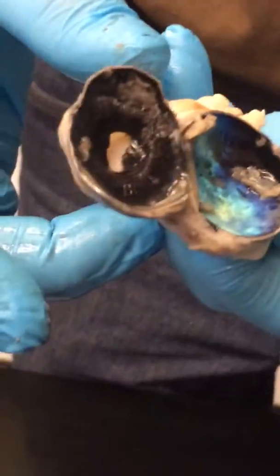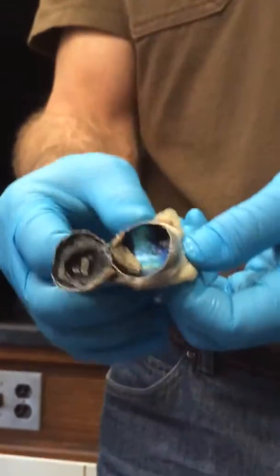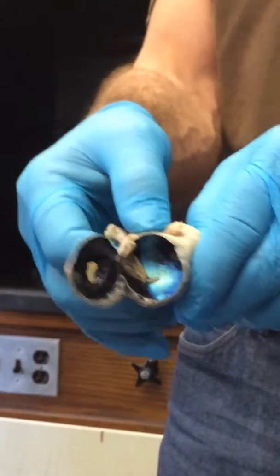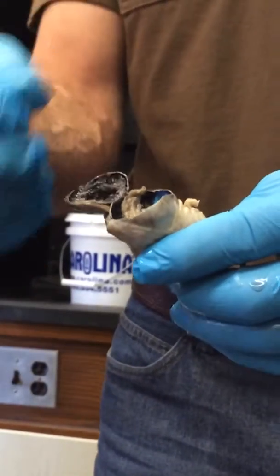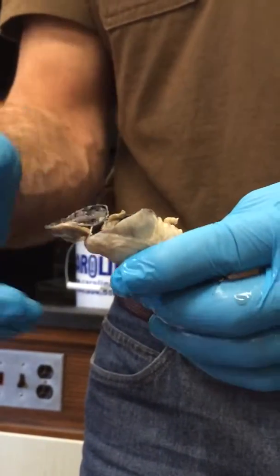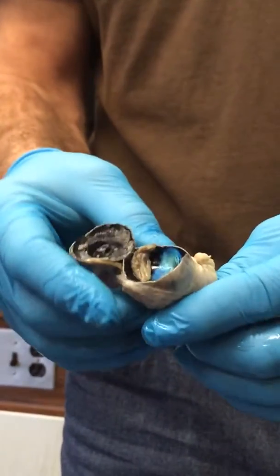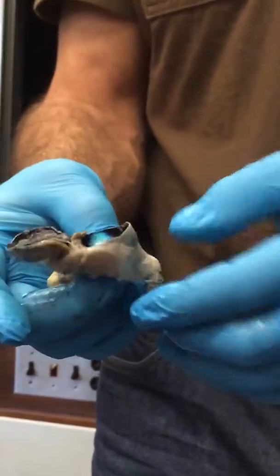And this is one of those things that if you shine a light into the eyes of a dog or a cat or a deer or a fox, and you see the green or the blue, that's a refraction or reflection from the back of the eye. So it's always that color. Yeah, variations. But this is kind of unique to these animals and not so much to us.